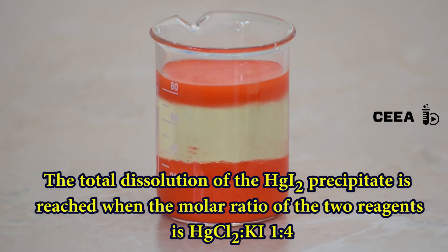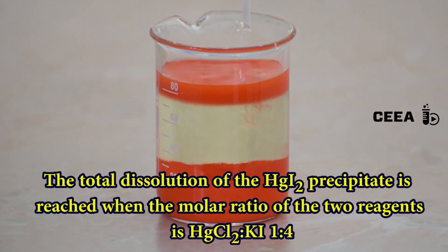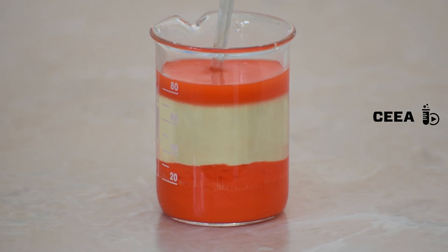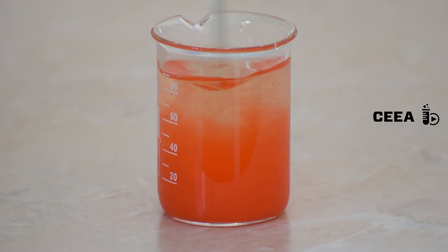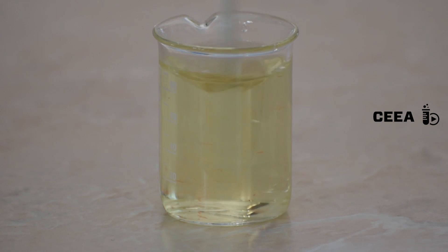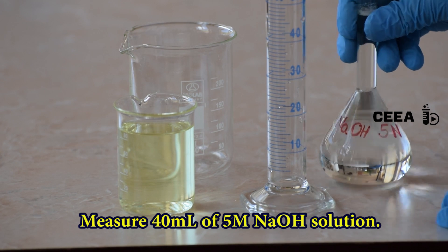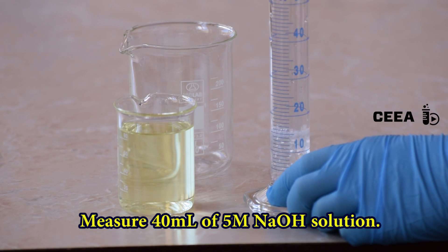The equation describing this process reveals the formation of potassium tetraiodo mercurate. At a molar ratio of 1 to 4 mercury chloride to potassium iodide, we get the complete dissolution of the mercury iodide precipitate. Observe the yellowish color of the complex solution. Measure 40 milliliters of the 5 molar sodium hydroxide solution.